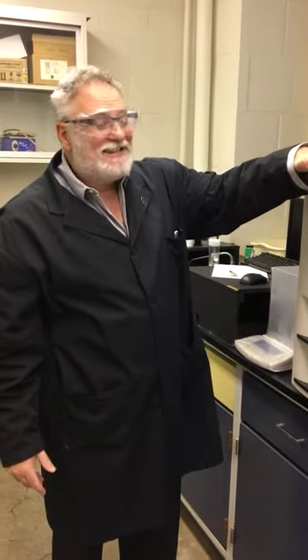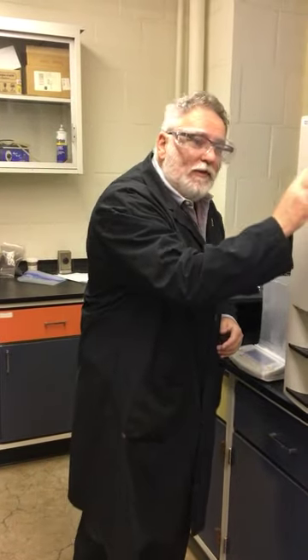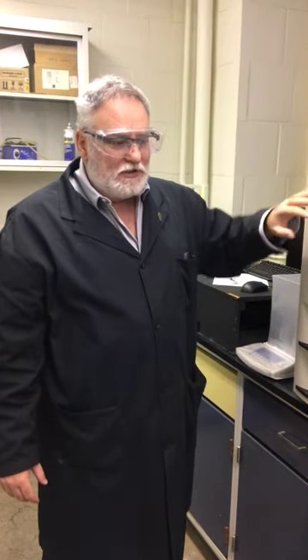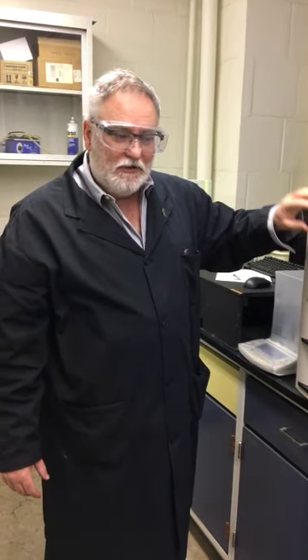You make a move to the calibration line, it corrects that data, and it's a weighted move, and it will go back and correct all of the other information. So it's quite a nice system, but we do have to be careful of that drift. So just to go through the system again, you have calibration runs, the system purges, it goes through a combustion step, there's an analysis step, and then of course we have to accommodate drift, and then of course there are corrections to the data and manipulations that are well covered in the ASTMs.